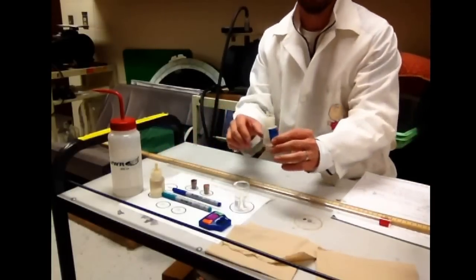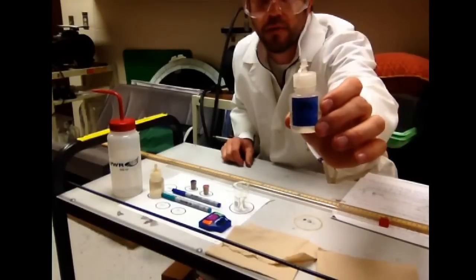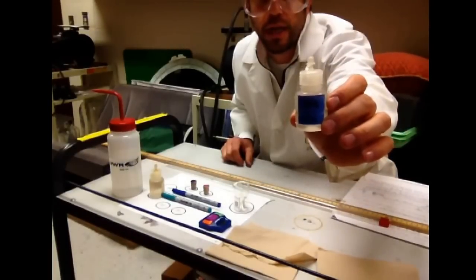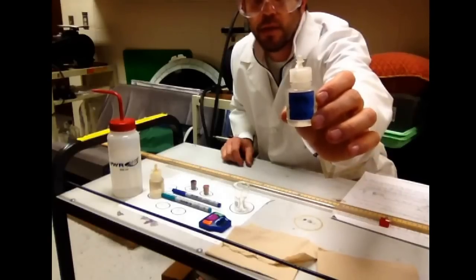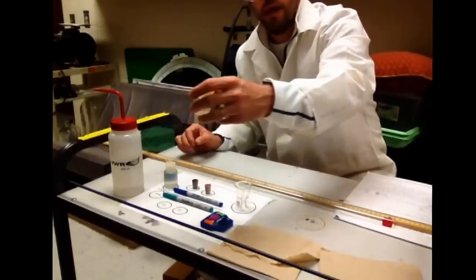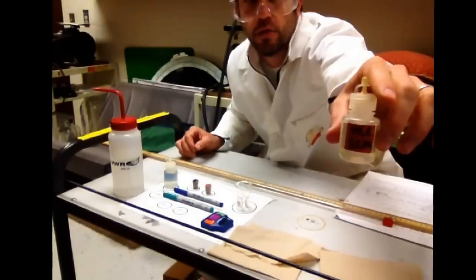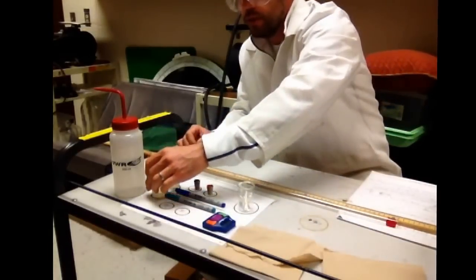Some of the dangers, some of the concerns we have, and I want you to be of utmost careful with this. This is concentrated ammonia, 15 molar. And then we have 12 molar concentrated hydrochloric acid. Those are two big safety concerns I want you to be aware of.